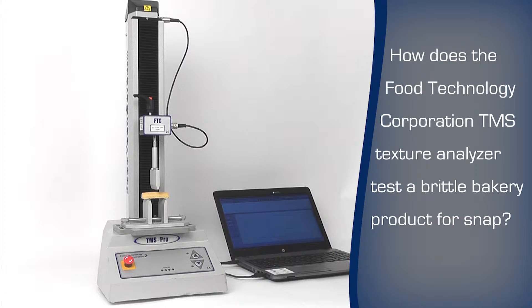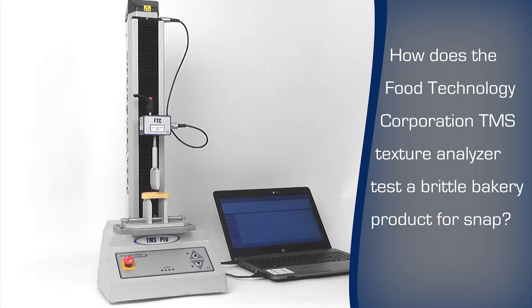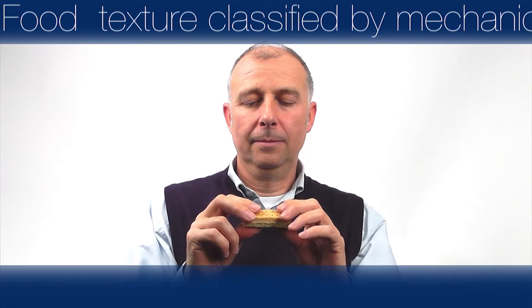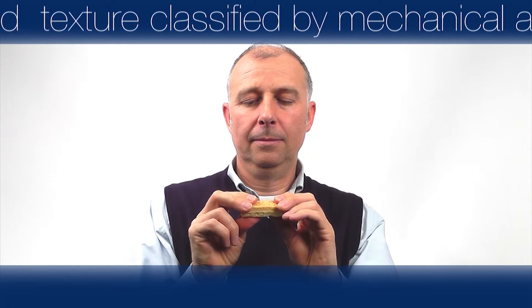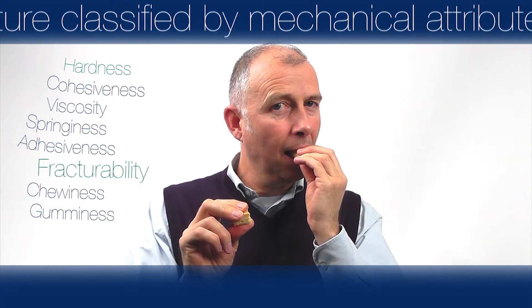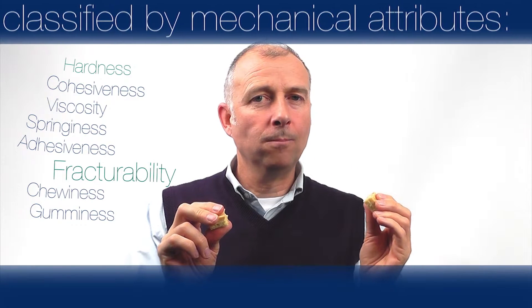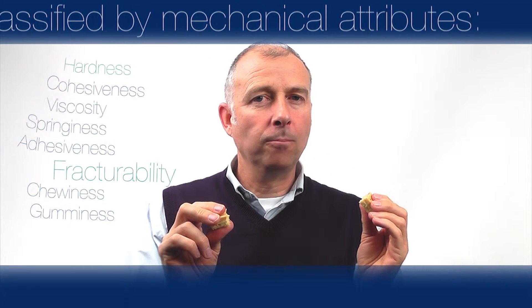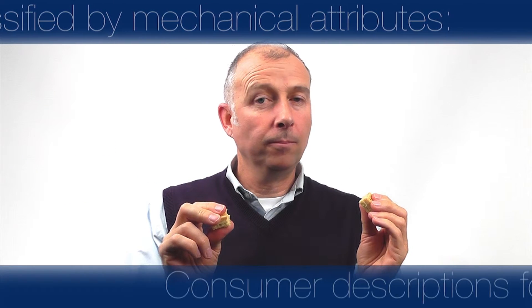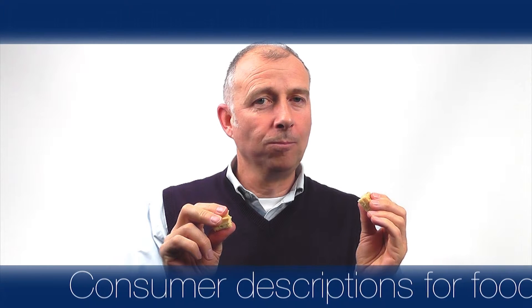The FTC texture analyzer can test shortbread snap. Food texture can be scientifically classified by a number of mechanical attributes: hardness, cohesiveness, viscosity, springiness, adhesiveness, fracturability, chewiness and gumminess.